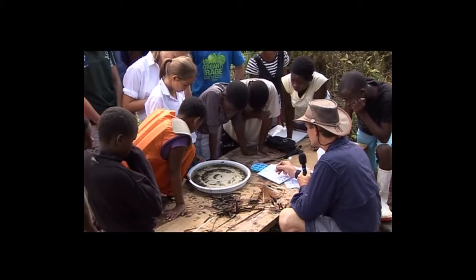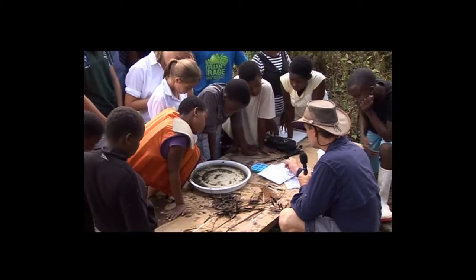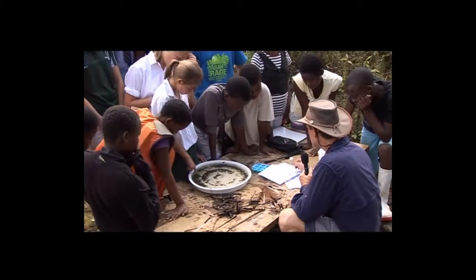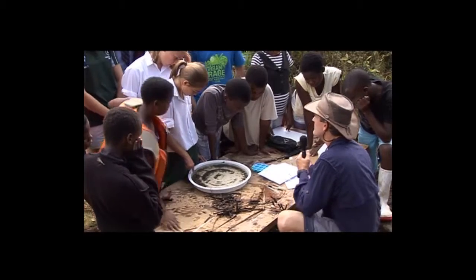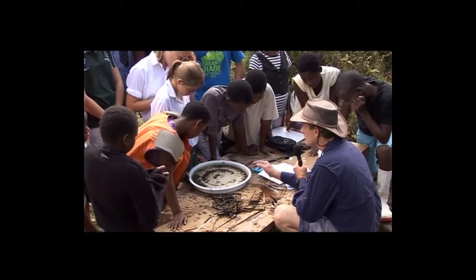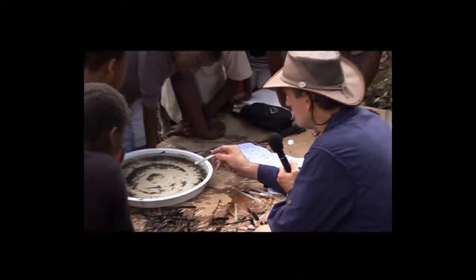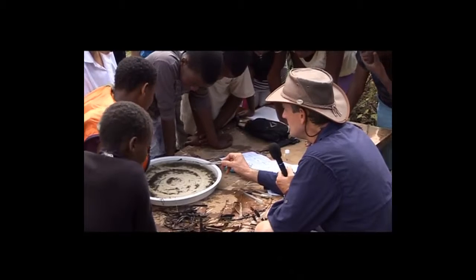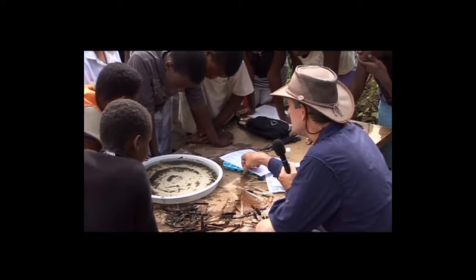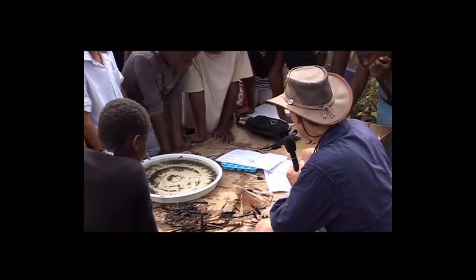It's asking questions all the time. Does it have legs? How many legs? Is it 4 pairs of legs? 3 pairs of legs? Does it have wings? No wings? Does it have a tail? And these sorts of questions it's asking, and that all helps us to identify what we might have in our tray here. So what we do now is we look at our sample and see how many different things we can identify that we can find on our sheets here, and then we'd note those on the back of the score sheet here.